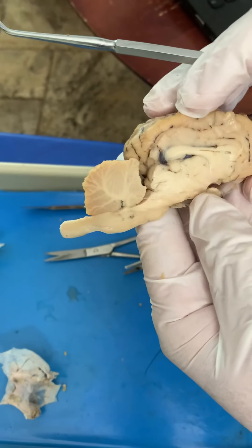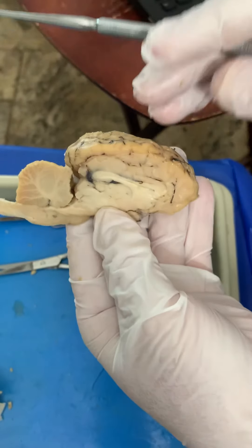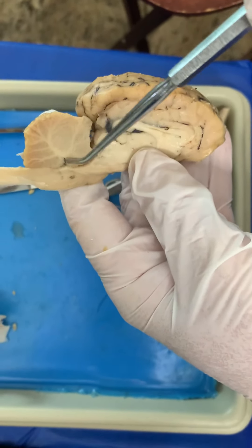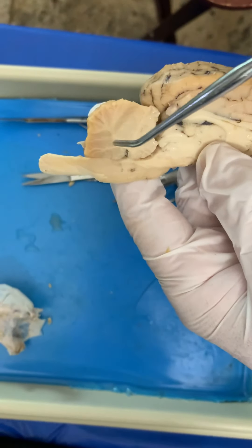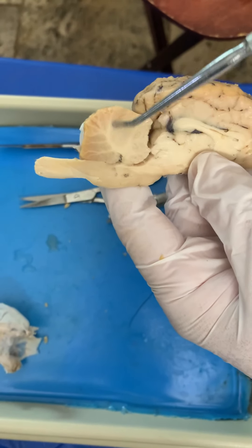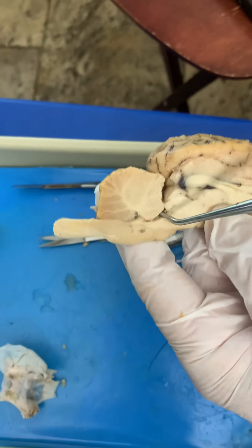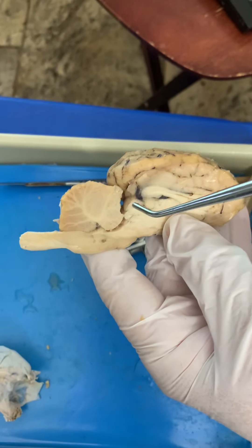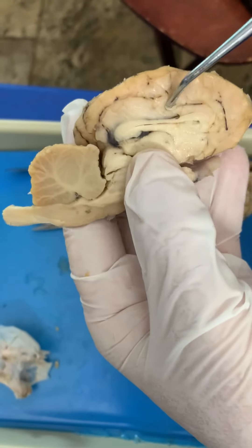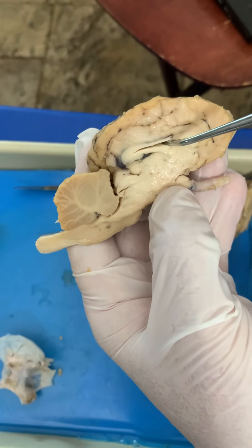Here's your corpus callosum, your lateral ventricle, your septum pellucidum — all the stuff that you saw in lecture, now you're able to see it in the lab. You can also see the inside of the cerebellum — see how it looks like these little trees? This is called the arbor vitae: arbor like tree, vitae like life, so the tree of life. You can see these little areas and the different structures we saw before.